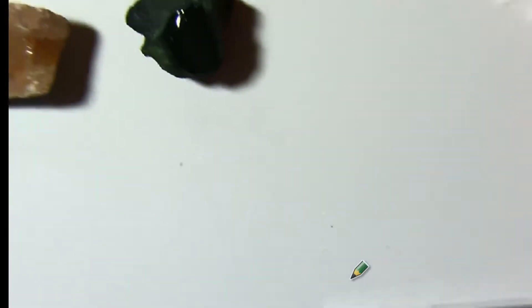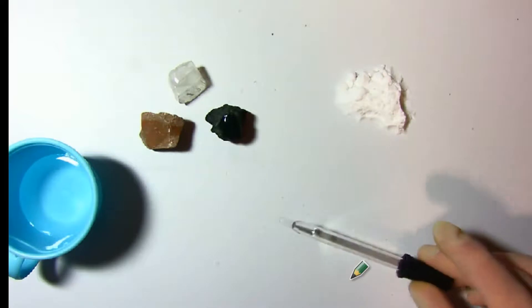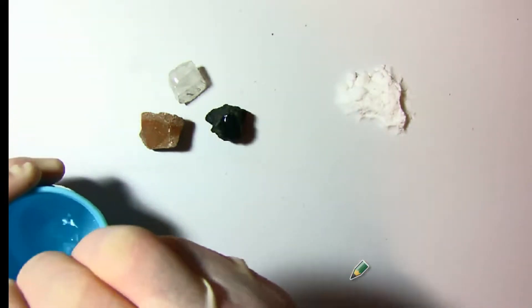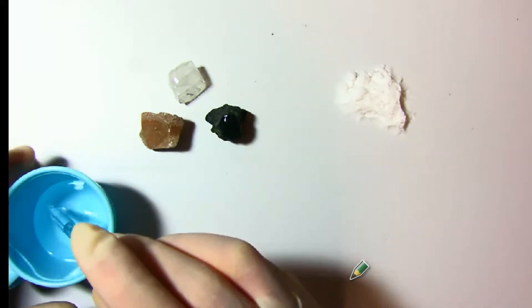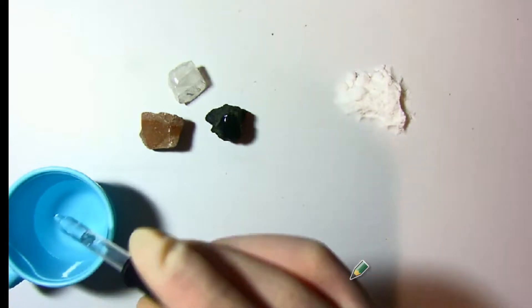We've got, I'm going to zoom out of this. We don't even have to zoom in. This one's going to be very obvious once you see what it is. This is baking soda. Baking soda? Isn't that what you put in volcanoes and add vinegar and make them blow up? It's exactly what it is. In fact, the chemical name of baking soda is sodium bicarbonate. Carbonate! There's carbonates in them.